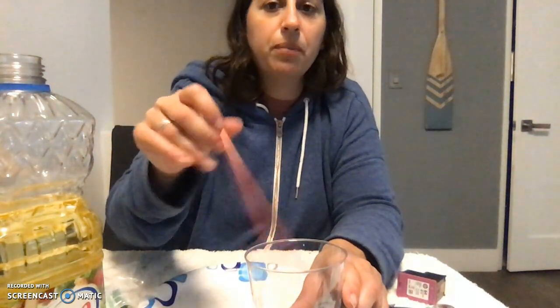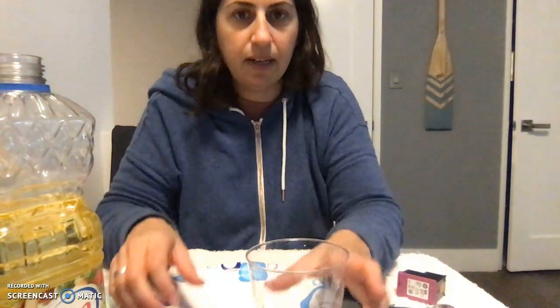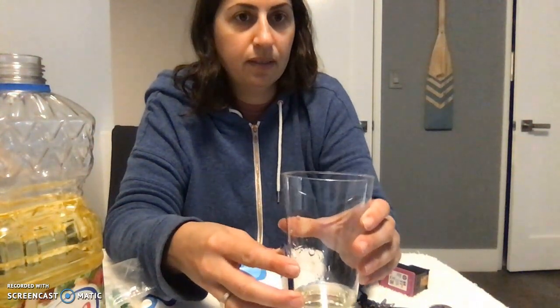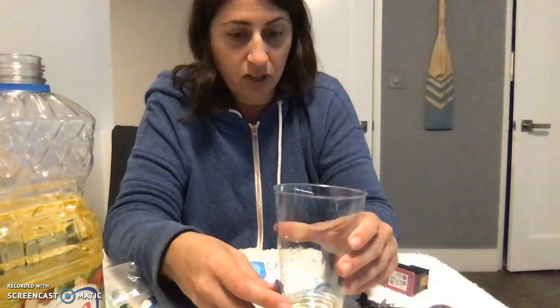Now that we have our mixture, we're going to pour it into another glass to make handling it easier, although I think this will work in this glass here. So we have a mixture, we're going to pour it into a smaller glass, which we said we're not going to do. So let's test it out. The goal is to place our magnet into our container and see if the liquid magnetizes. So here is our magnet right here. Let's see if this magnetizes. It does not magnetize.